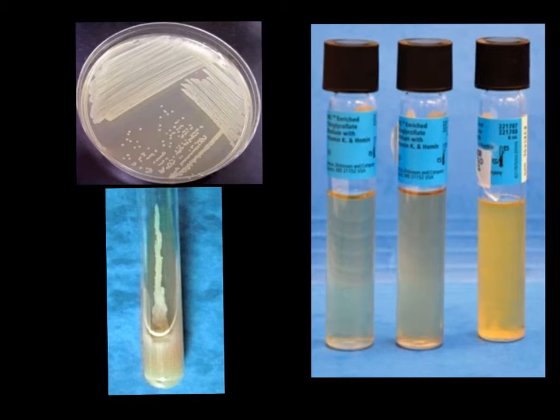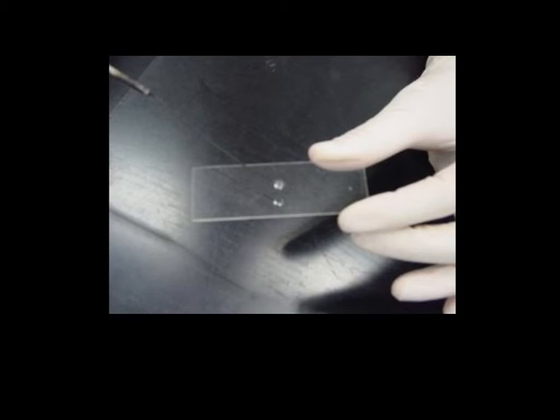Once we have done so, we can use our sterilized flame loop and transfer one to two drops of the bacteria to the center of a clean glass slide. We want to be close to but not overlap that grease pencil mark. So here we are transferring a dropful of that nutrient broth with the bacteria to our bacteria slide.